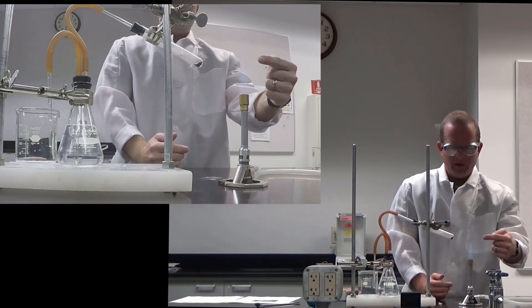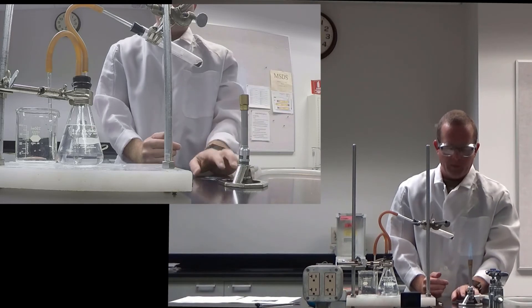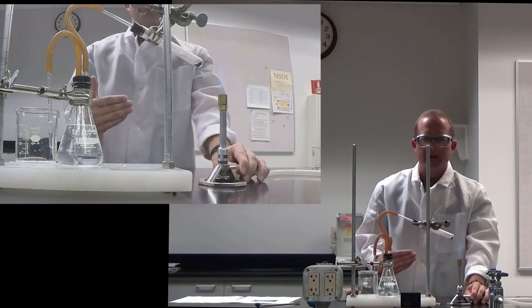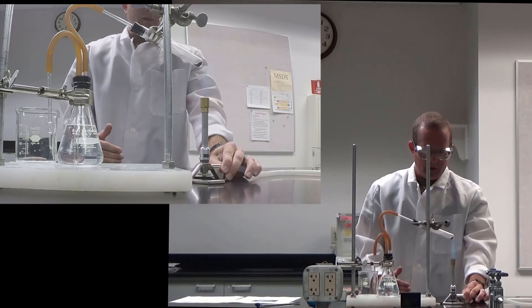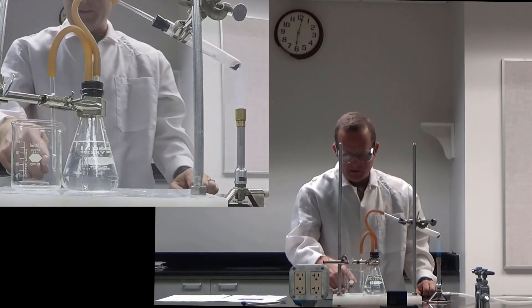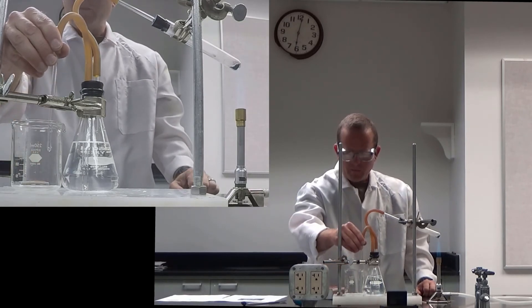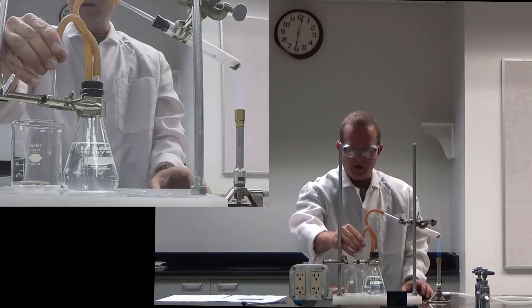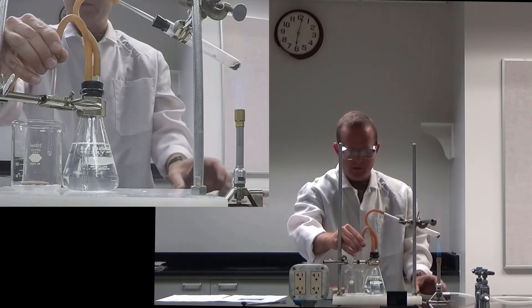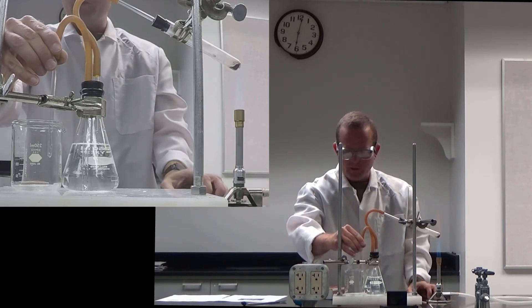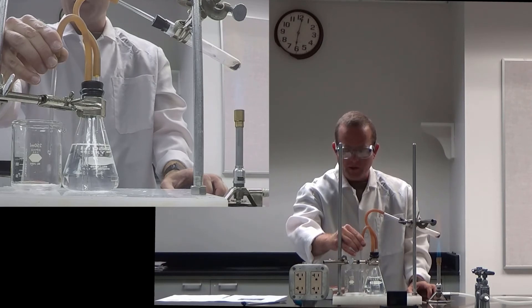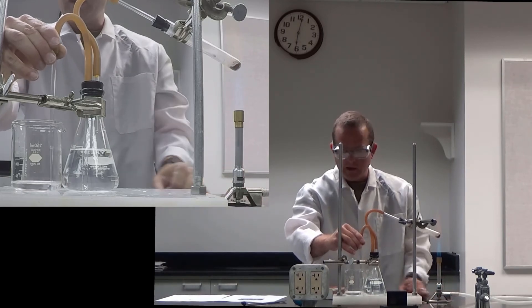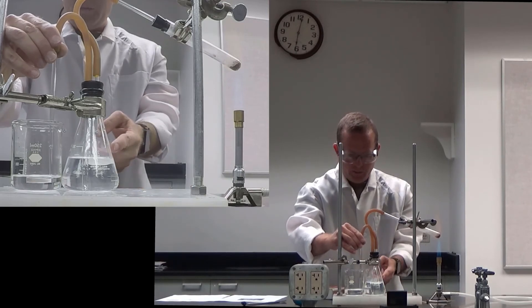OK. And then the hottest point of that flame is going to be right at the tip of that little blue flame. And so now we'll decompose our potassium chlorate and we want to start that reaction kind of slowly. So we're going to bring the flame in a little just from the side. And now you can see the water start to drip over here. And in a minute you'll start to see the white potassium chlorate powder start to melt and decompose. Continue to bring the flame in more. You can see the dripping increase as more and more oxygen gas is generated.